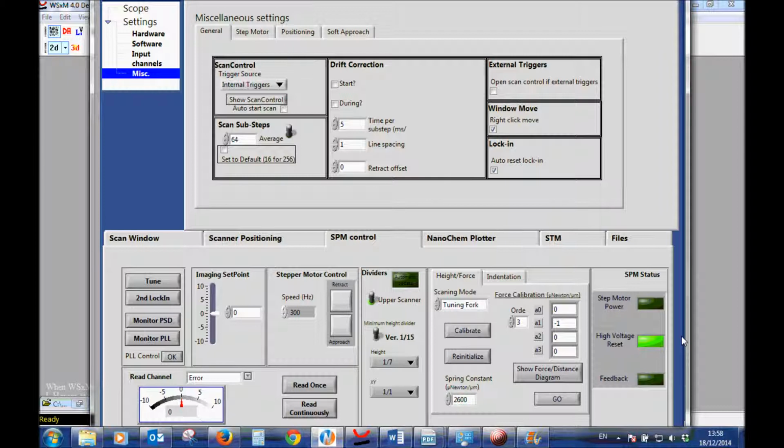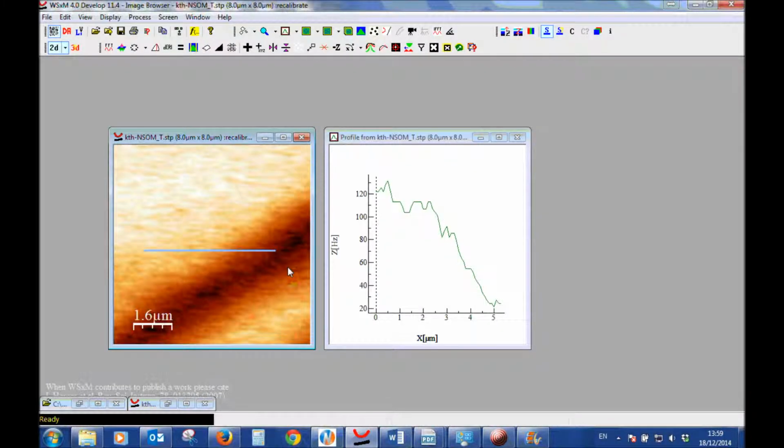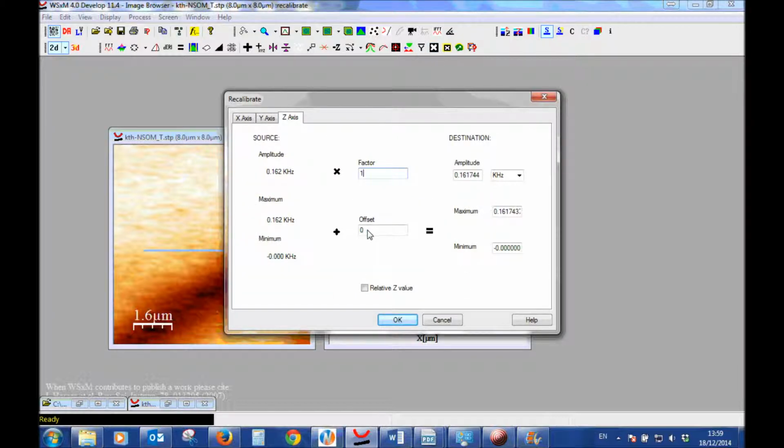Another option is to look at the noise level before we turn the laser on, after the photon counter is turned on. Mostly we will see a certain noise signal, not always but sometimes, and we can read that noise signal by looking at the NSOM. So we're going to look at the NSOM channel, and then we can do read continuously, and we'll see a certain value here, and that value we can add to the WxSM in the same way which we added the offset. We can add that value right here.